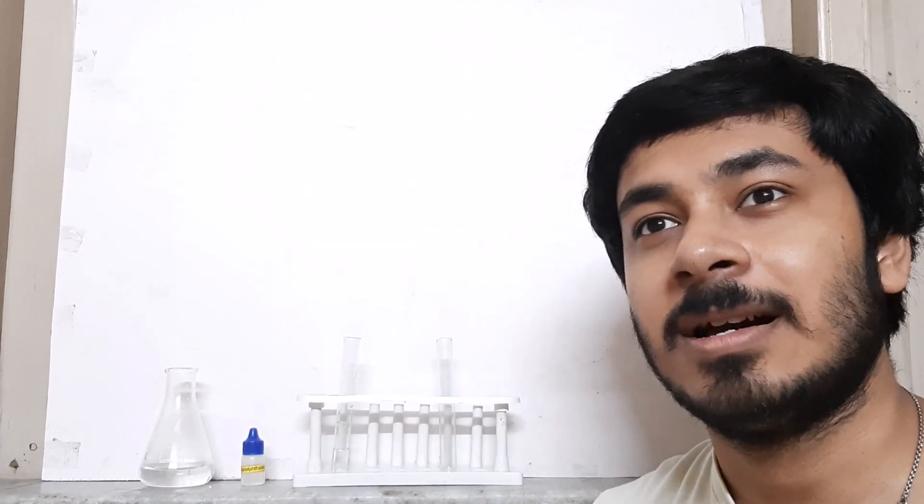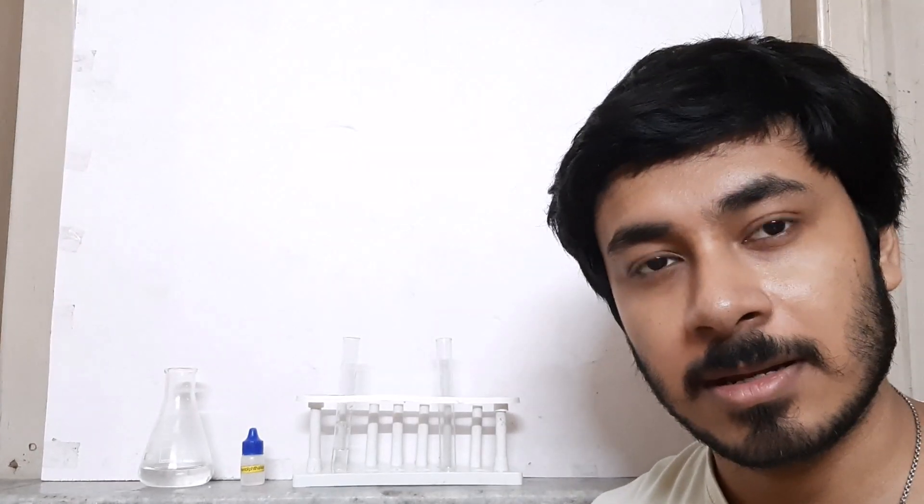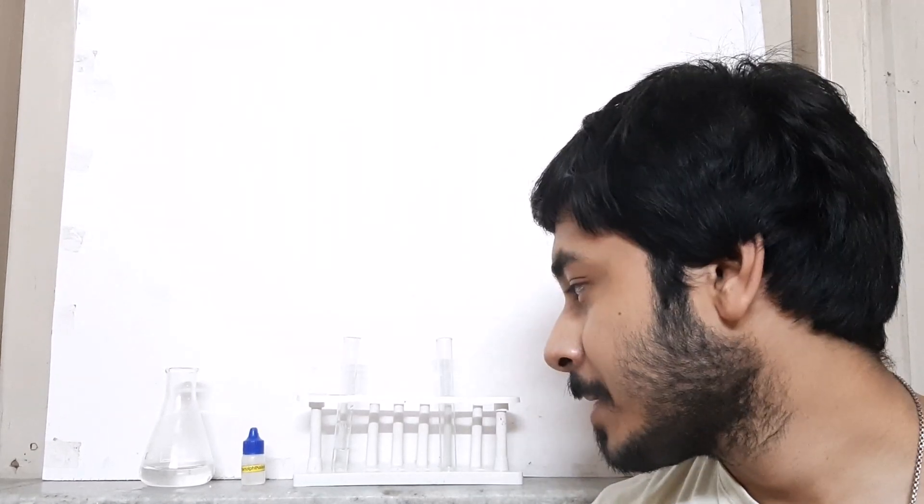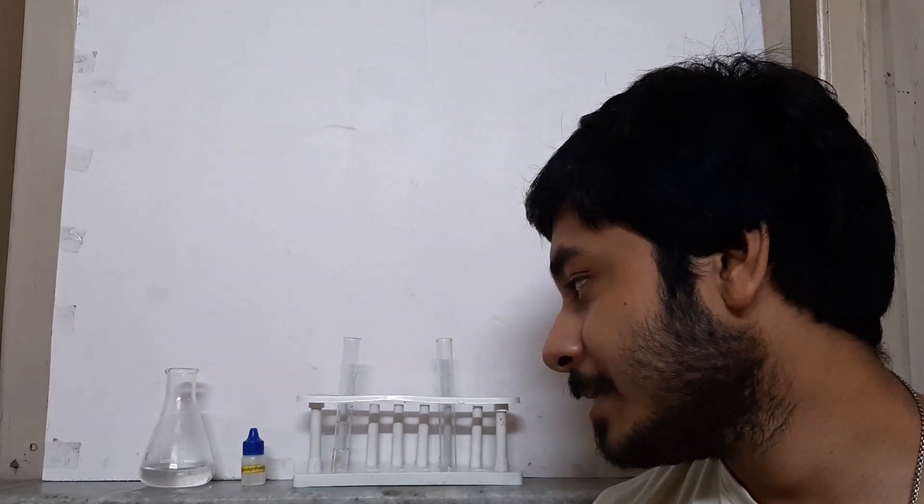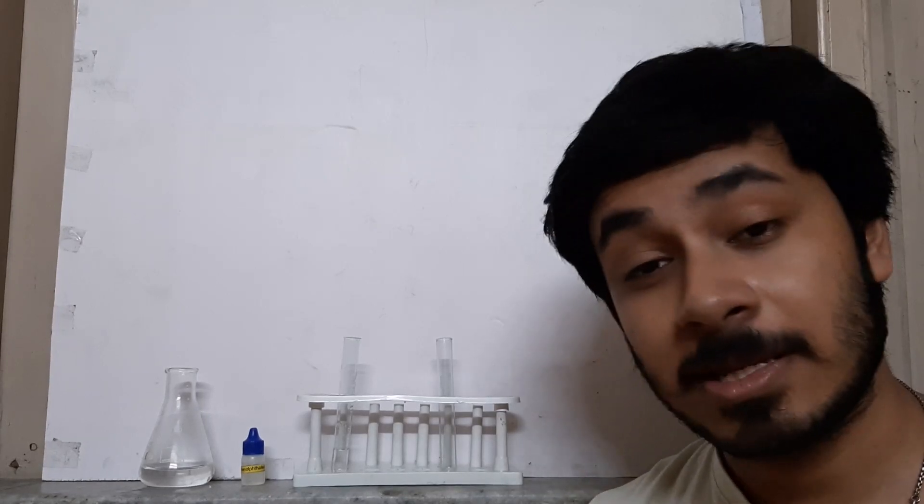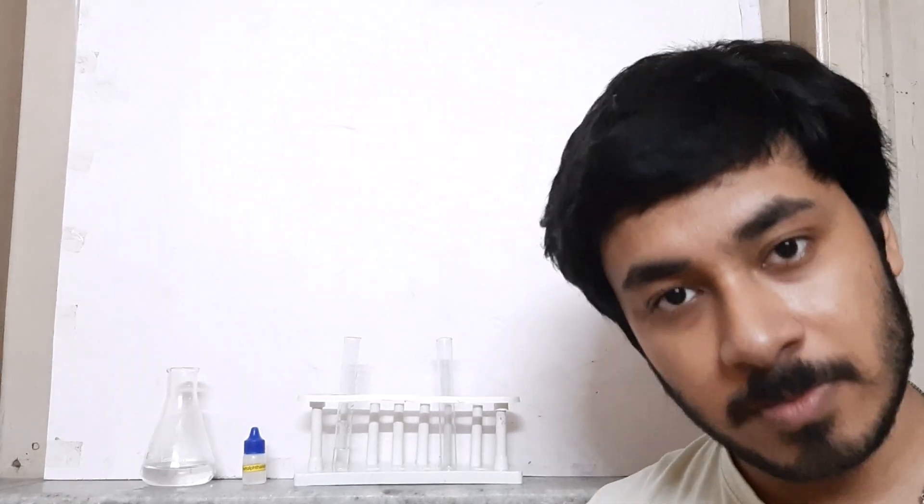It's not an efficient experiment, to be honest. It's actually to identify acids and bases—basically kindergarten stuff for good chemists and chemistry lovers. Today I'm going to do a phenolphthalein test.